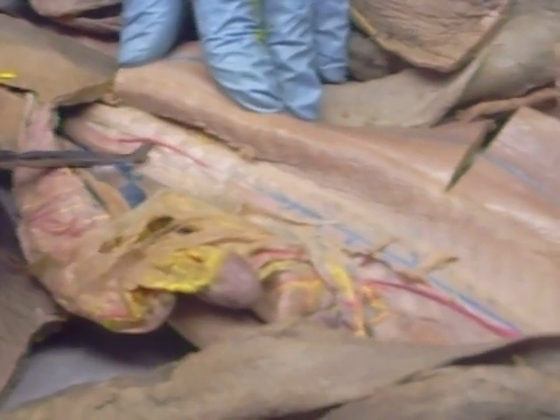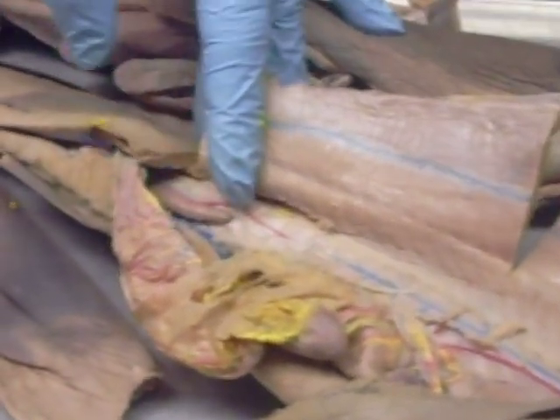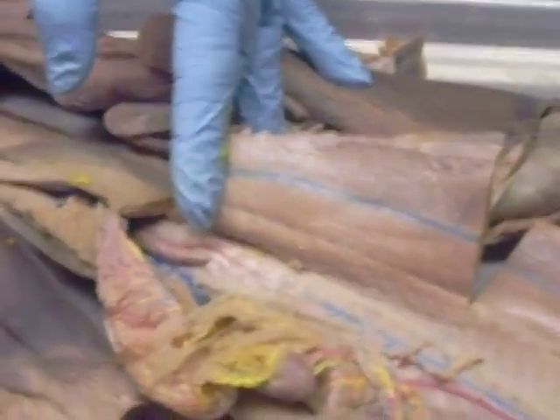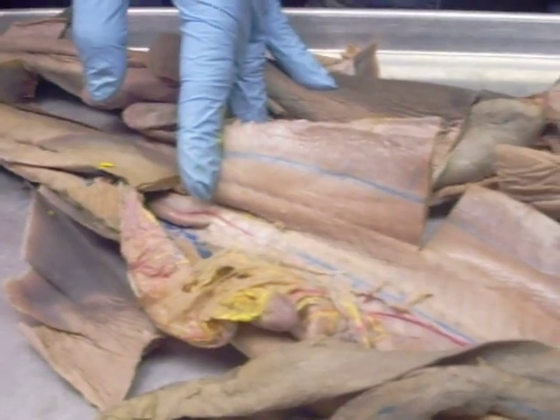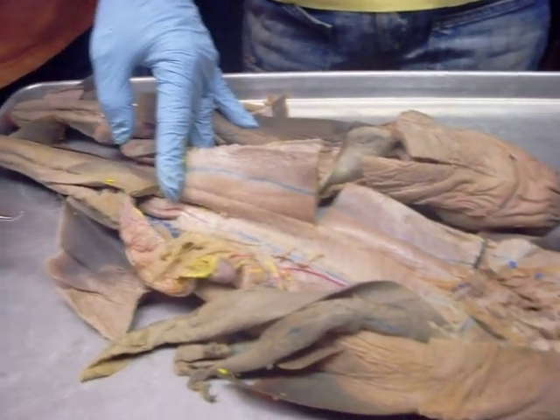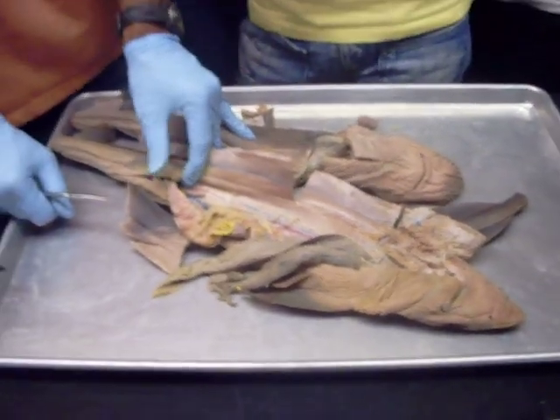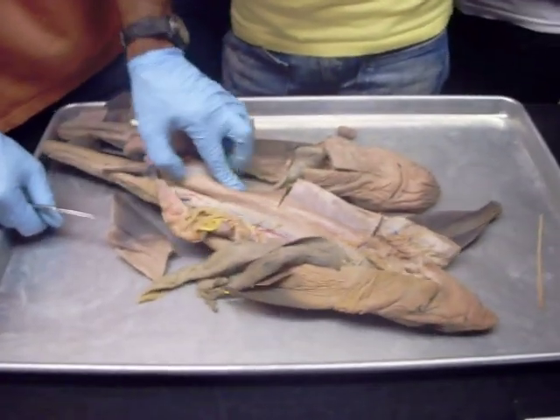And we have the rectal, which is back here — I don't know if I gave you that one. So those are the ones we need to know. Really you need to know everything that's on the list, but think about what I'm going to do — I want to pin out things that are not ambiguous.